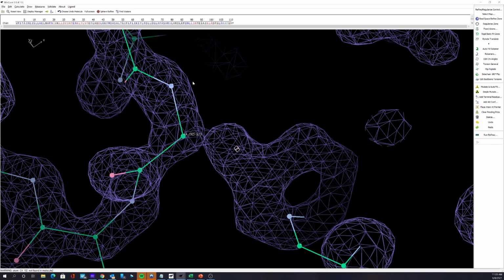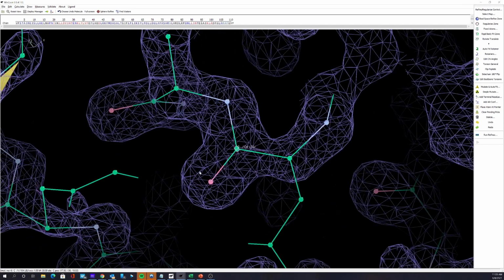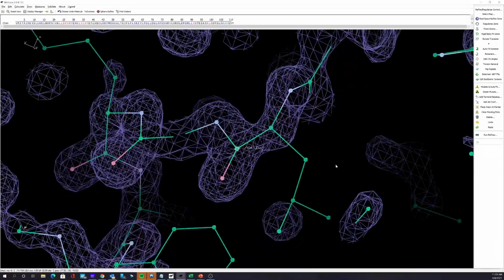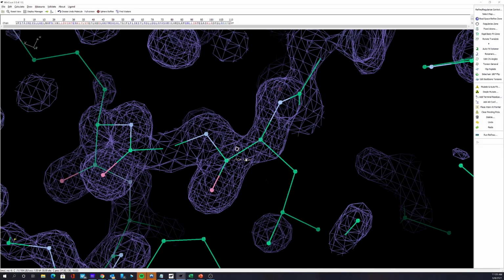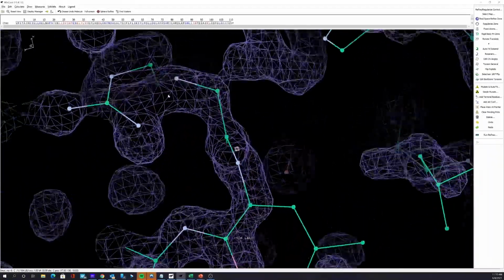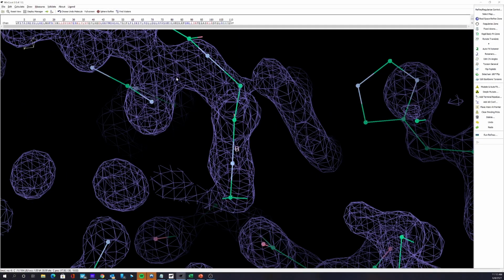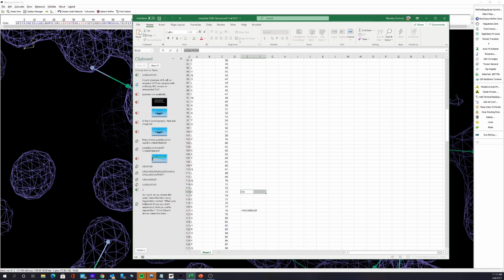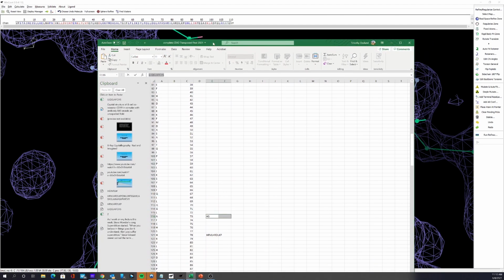So if we go there, you can see that the sequence is completely out. There's no electron density for this residue here. Something is completely wrong. So I had to start looking at a variety of things, and the first thing I looked at was the sequence, and it was clear that around residue 75 here, there was something going on.